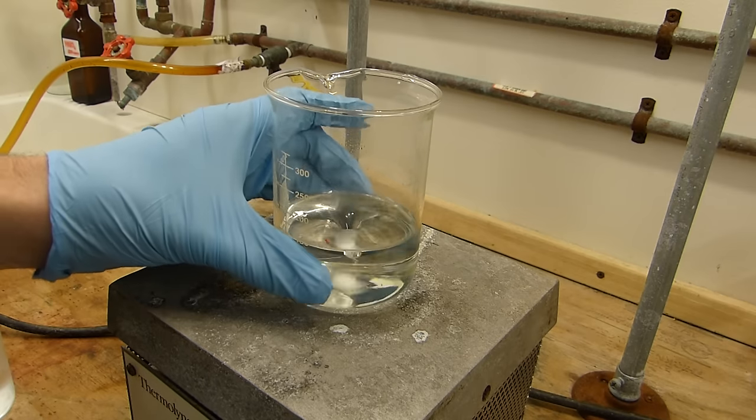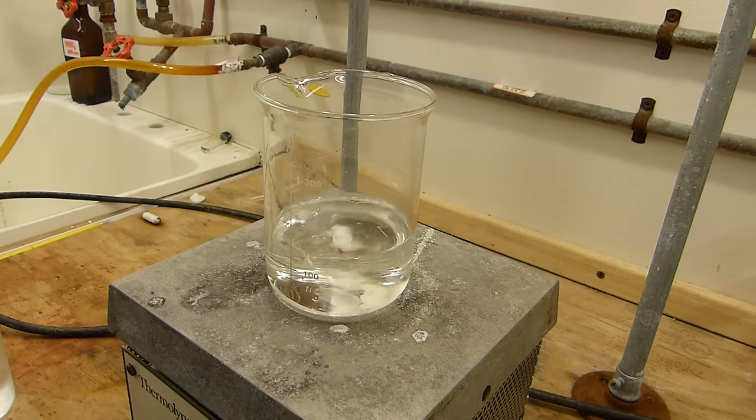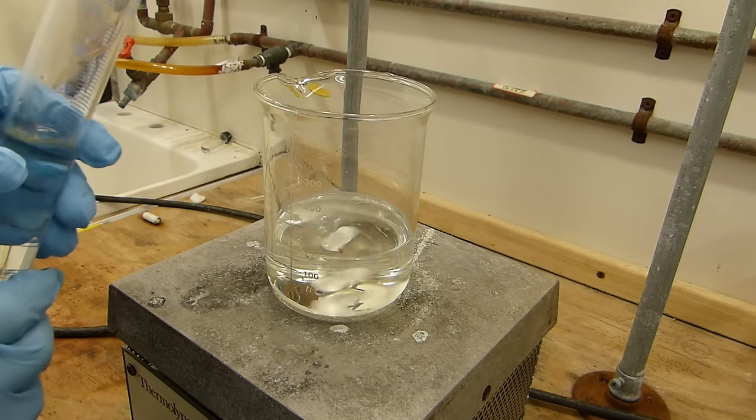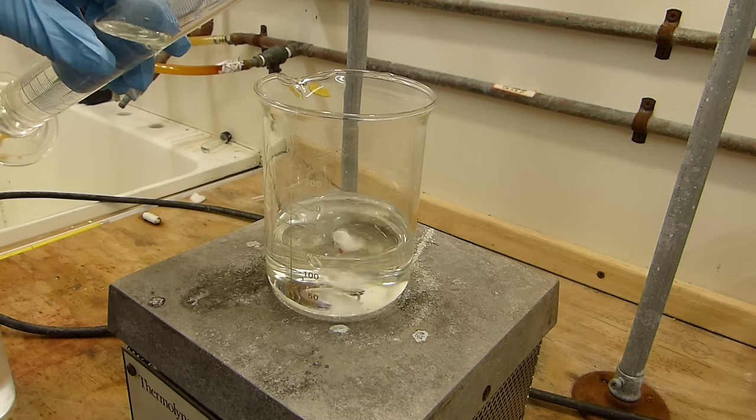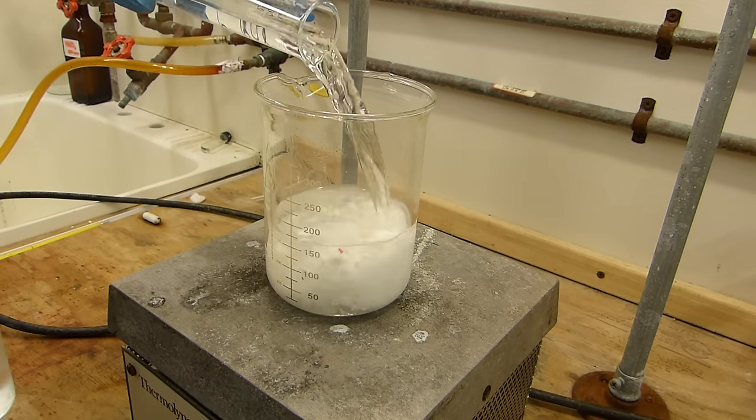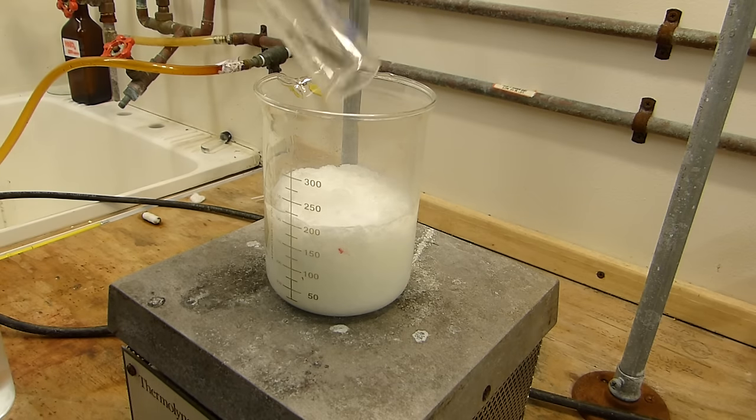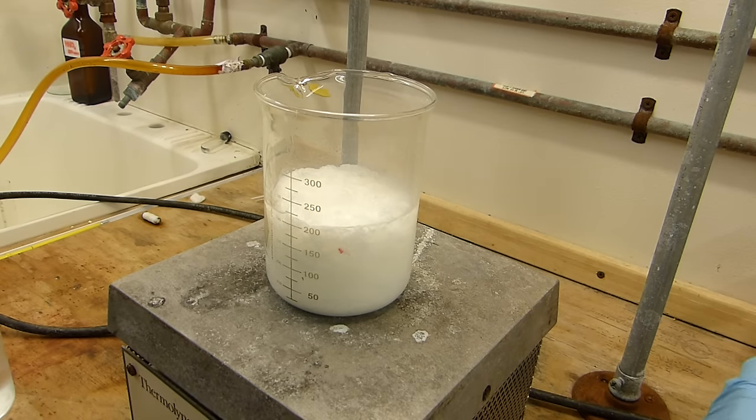The benzoic acid is now completely dissolved as you can see by the clarity of the solution. I'm now going to add the hydrochloric acid to precipitate the benzoic acid. This should be fairly dramatic. There we go.